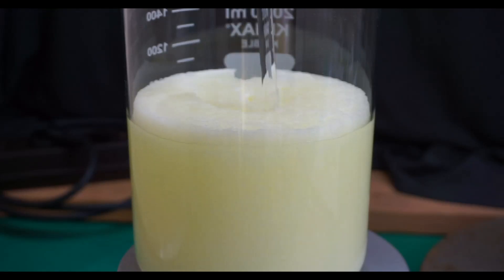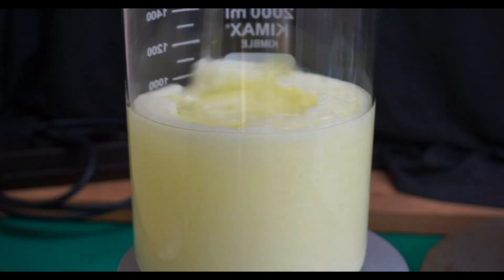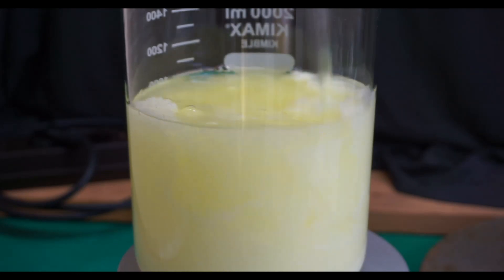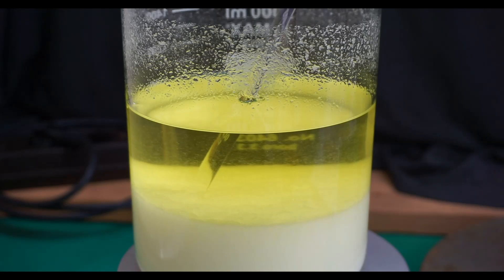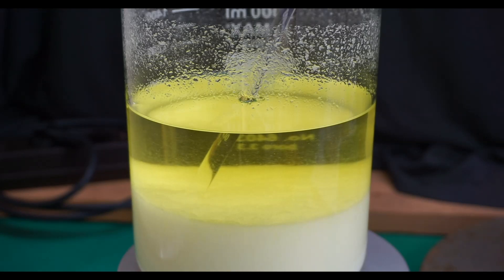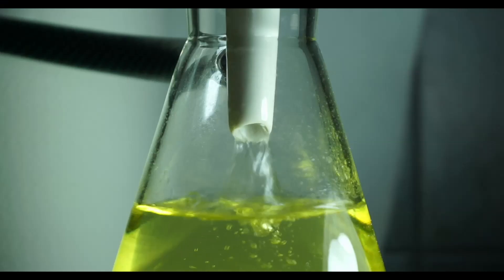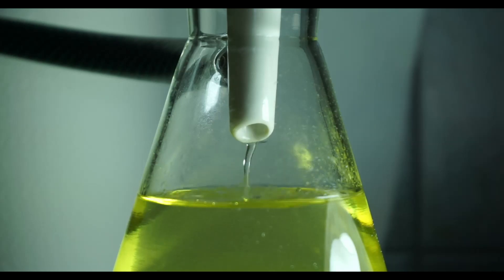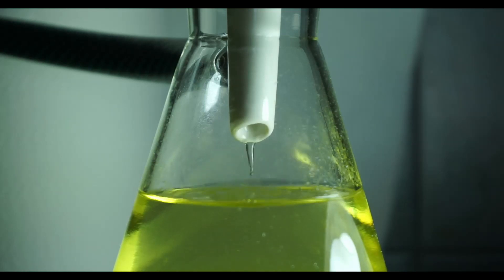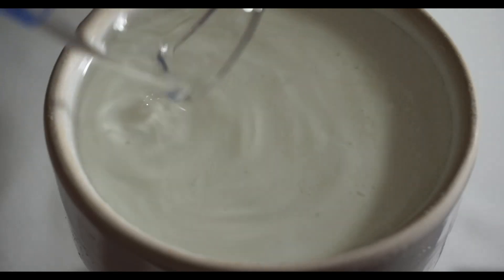The next morning I was greeted by a beautiful mass of crystals — it looked as if the entire content of the beaker had solidified. I broke up the crystalline mass with a glass stir rod. After the material settled to the bottom of the beaker, I decanted approximately 550 ml of the clear solution to reduce the volume of liquid I had to filter. I then proceeded to vacuum filter the remaining suspension and washed the solids on the Buchner funnel with 100 ml of fresh 96% ethanol.